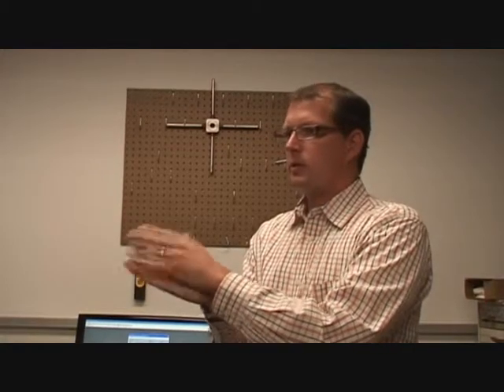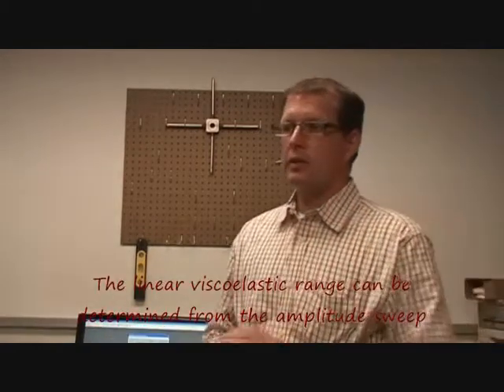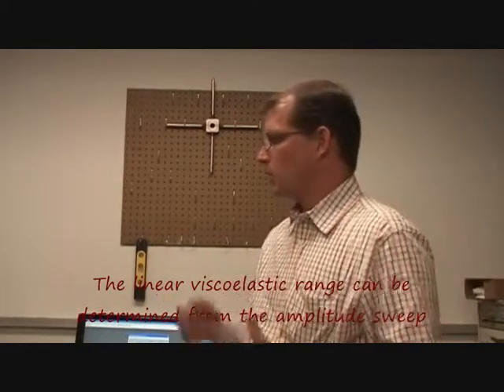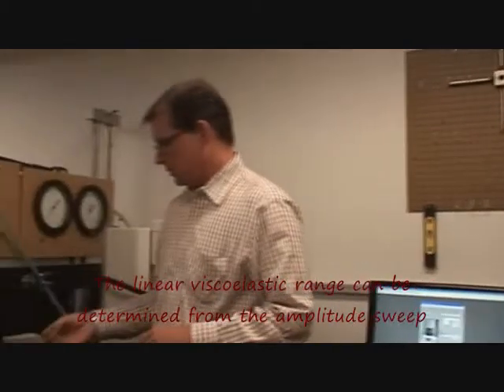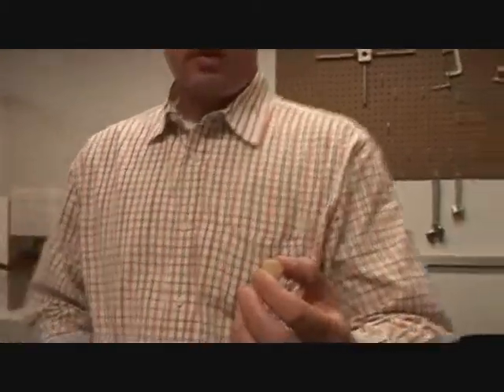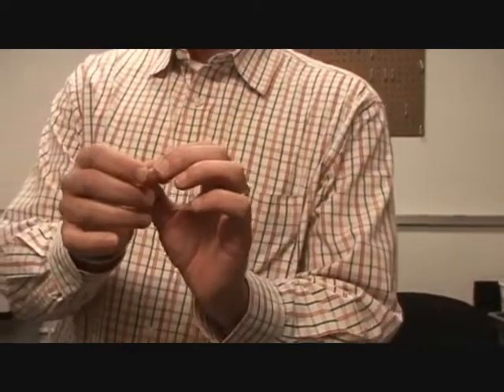This period we're going to do a fixed frequency — this is going to be very slow, small deformations. And that should give us our linear viscoelastic range. But at what temperature? Dr. Bardet was saying 25 degrees, and it's about 24 right now. Now if I look at these samples, they look a little stiff. This is wax — it can crack, fall apart, stuff like that.